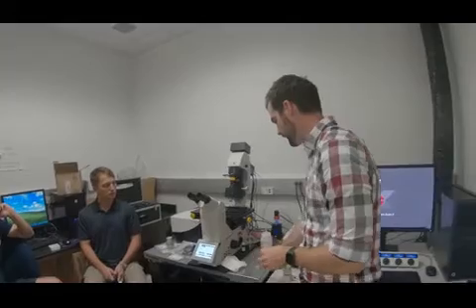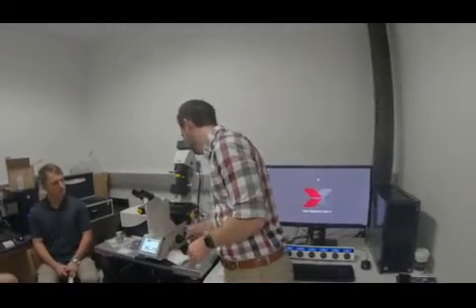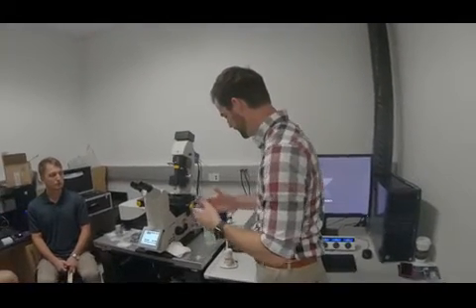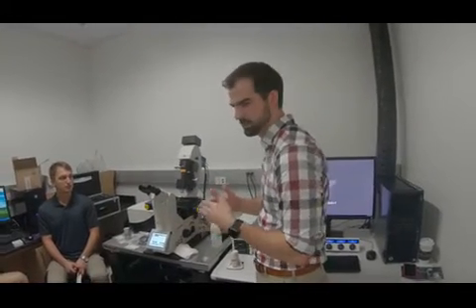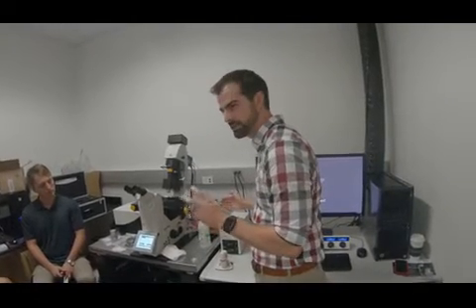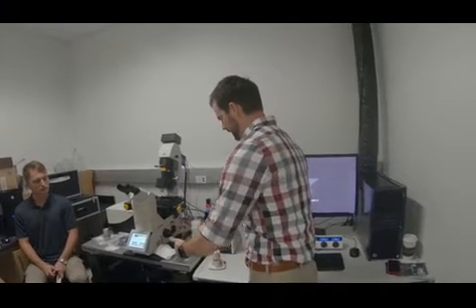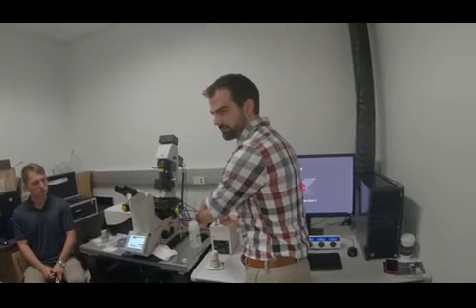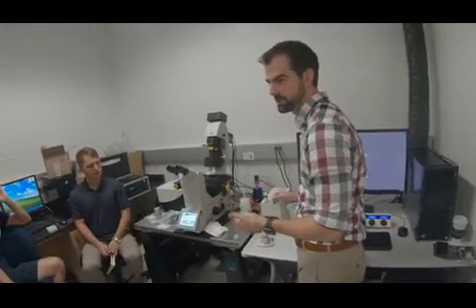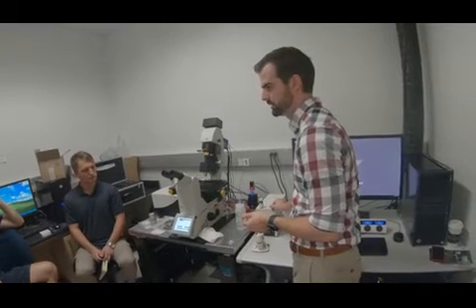So the way that light sheet works typically is you have, let's say, a sample, and then you have two objectives, held perpendicular to the sample. One is your detection objective, which views whatever is being excited, and then you have a perpendicular excitation objective. This objective forms a plane of light. Light sheet is universally called SPIM, or selective plane illumination microscopy.